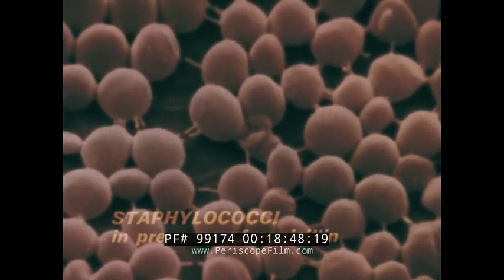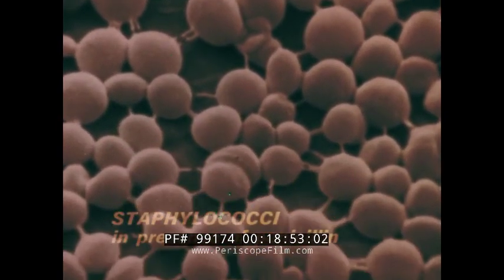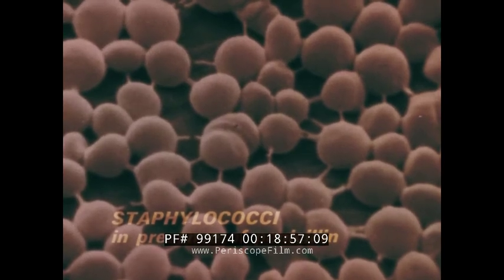Here are penicillin-resistant Staphylococci in the presence of penicillin. They appear normal. But in the presence of the antibiotic cephalothin, the bacteria swell and show granulations and protrusions of the cell wall.